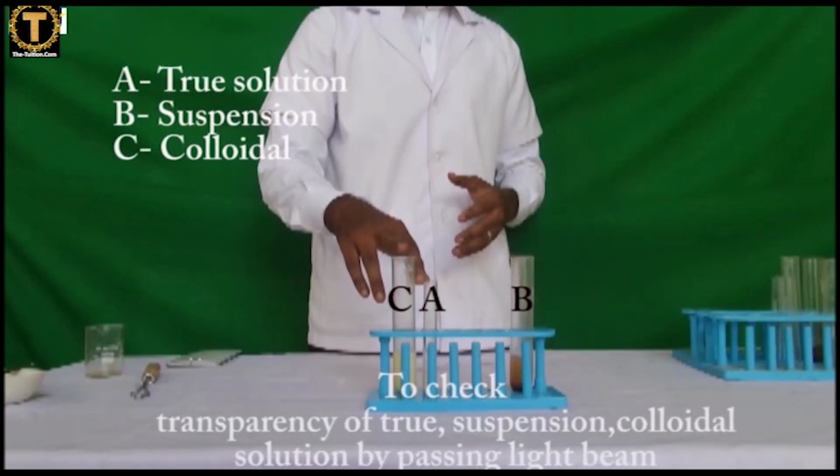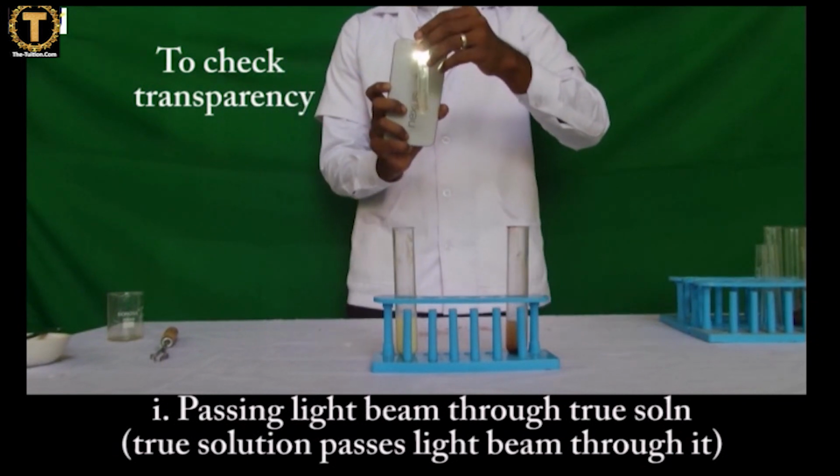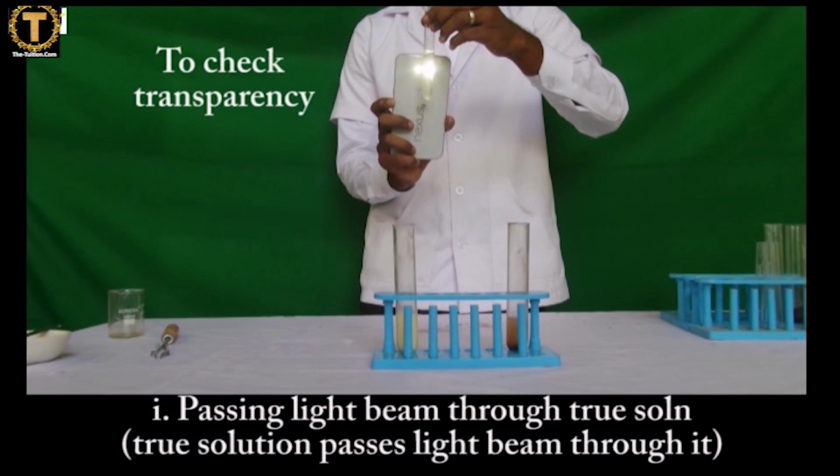To check transparency, place 3 test tubes on the stand and flash a beam of light to check the transparency. Record your observation.